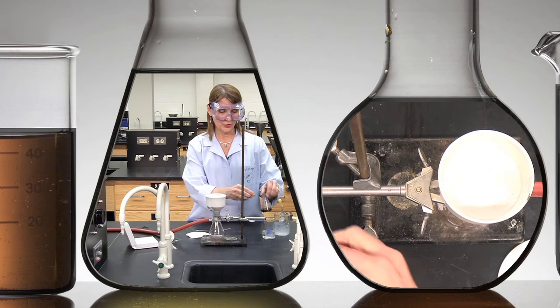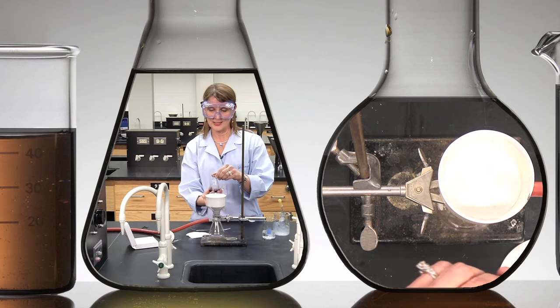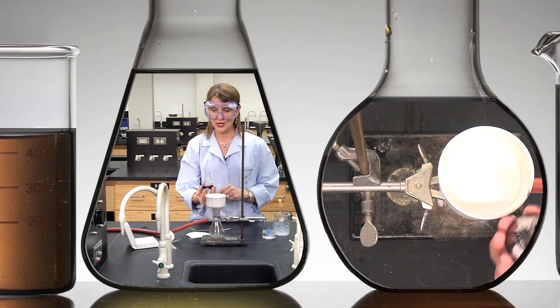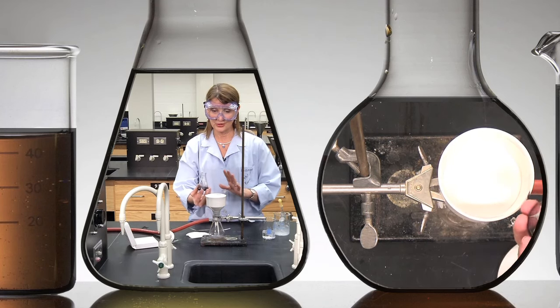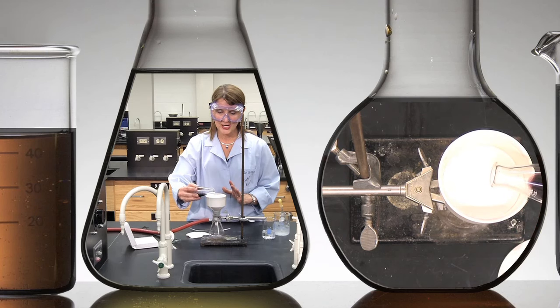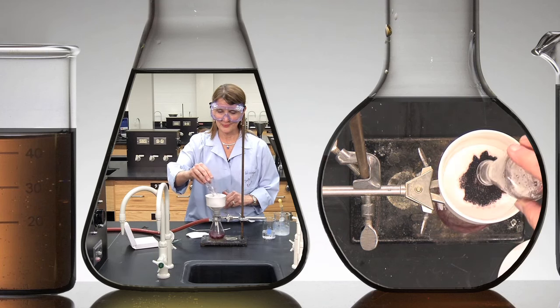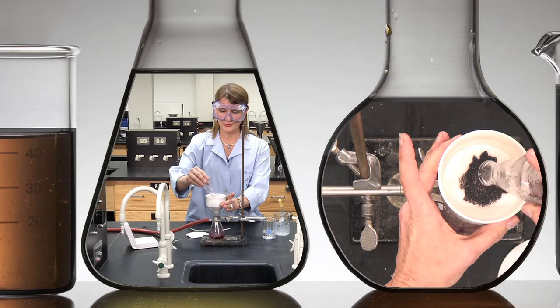Next, we have our crystals that are suspended in the solvent. You want to gently swirl to suspend the crystals and then pour in the center of the filter paper. Isn't that pretty?